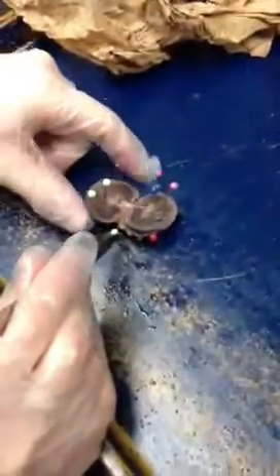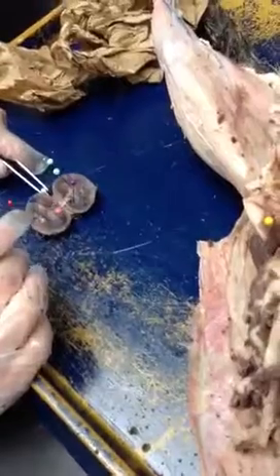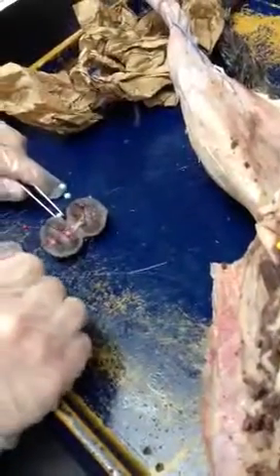Yes? All right. Okay. What's this pen? Hold on, where's my sheet? Oh, that's the middle one, right? The mint middle one. Hold on. Give me a second. Okay.